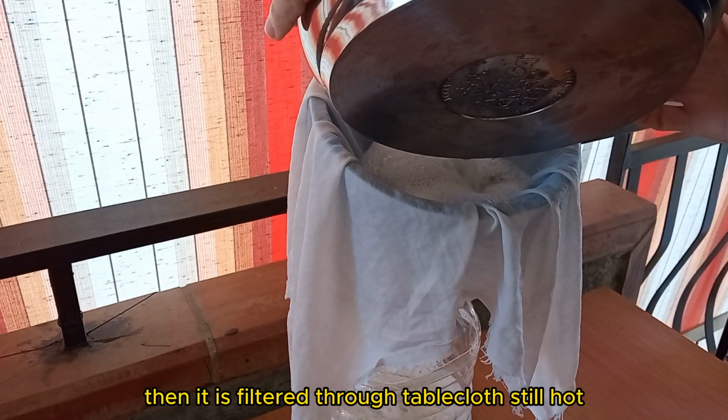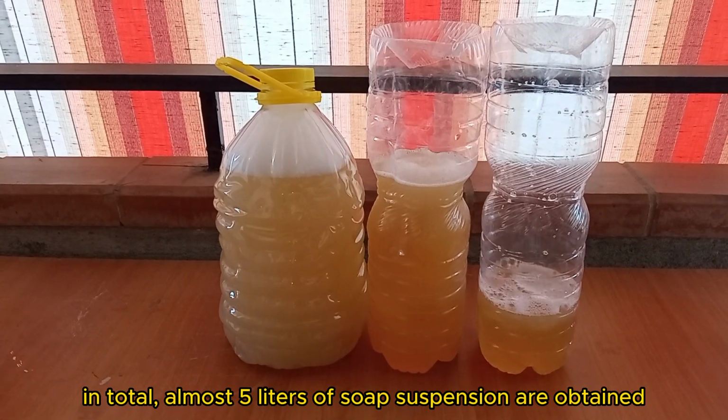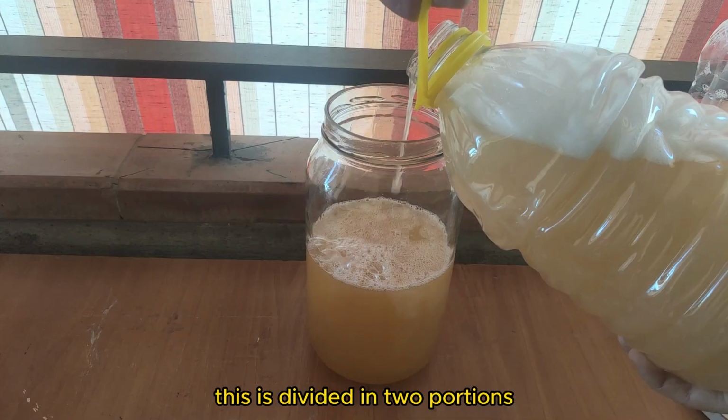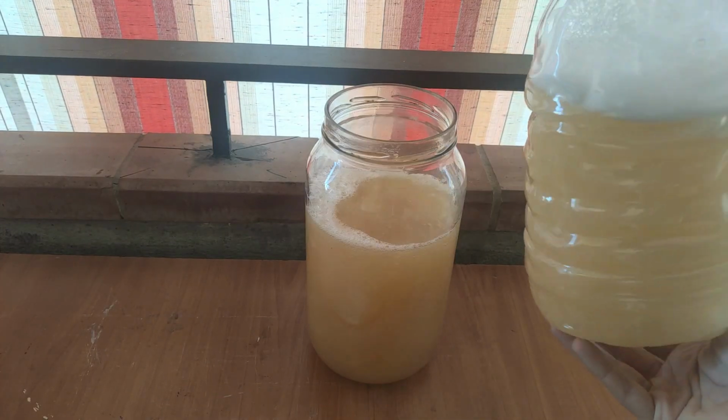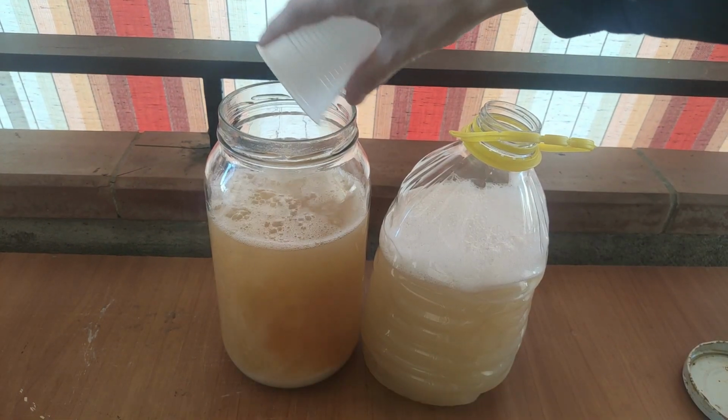Then it is filtered through tablecloth still hot. In total, almost 5 liters of soap suspension are obtained. This is divided into portions. To each portion, 100 grams of table salt is added.